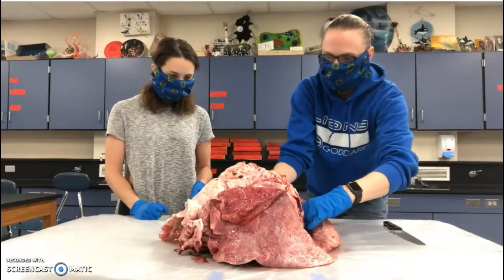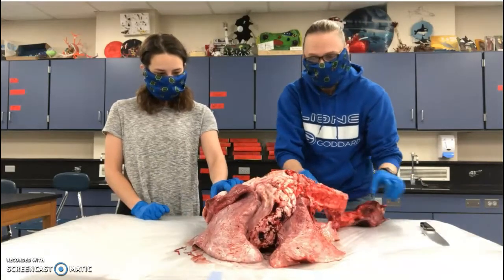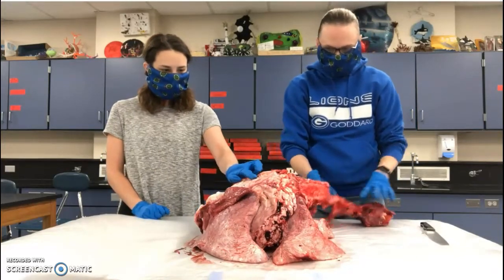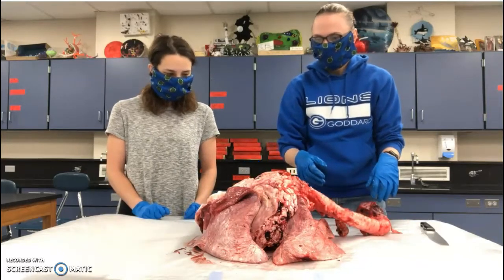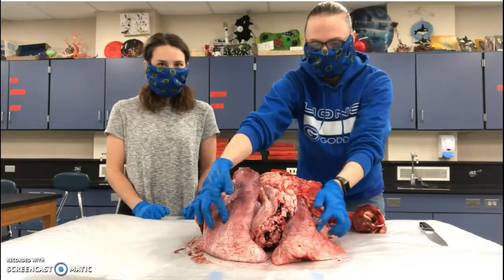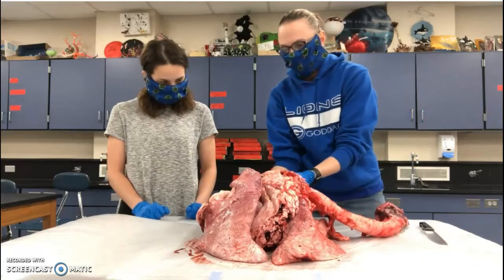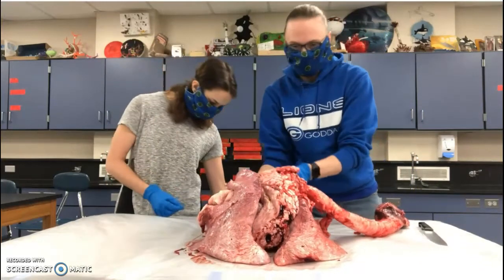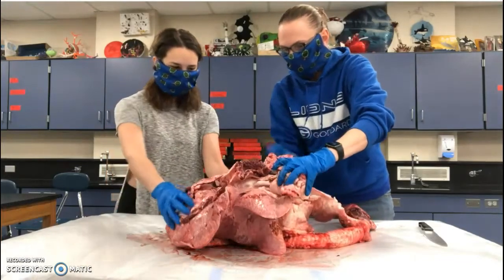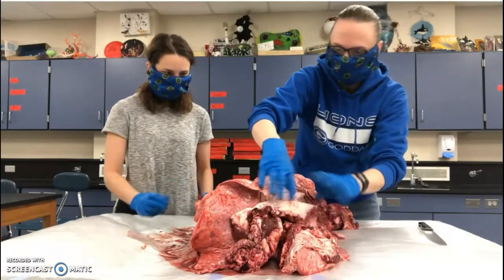Here is our cow heart and lung set. We're going to be learning the circulatory system today, the structures of the heart. I will make another video and go over the structures of the respiratory system, because we'll be learning that in a couple weeks. Here's the lungs — squishy. Big lung, trachea. A whole bunch of fat. And we'll get to that later.